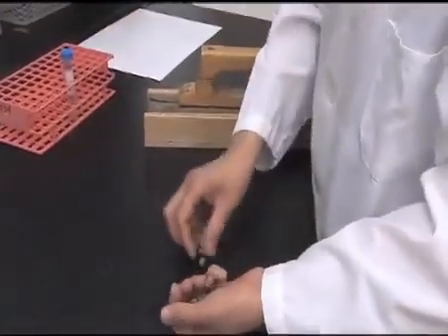Today we will introduce the hairy root composite plant protocol. Yeah, we use this protocol in several of our projects. Are you ready? We start it. Yeah. For our demonstration, we will use Medicago truncatula as an example.